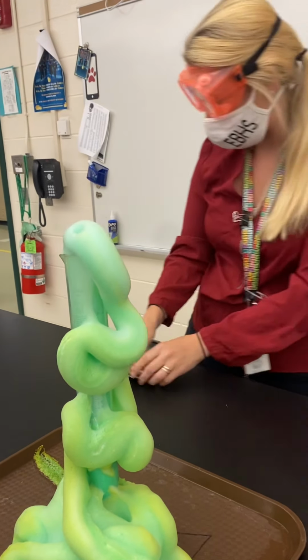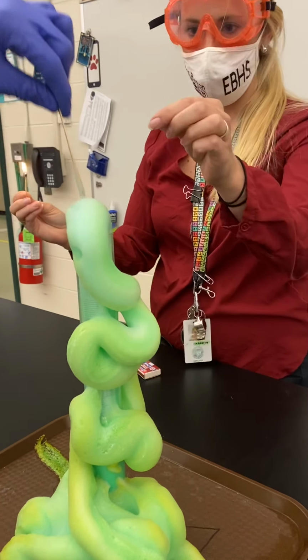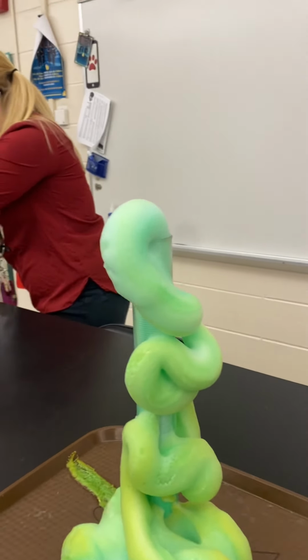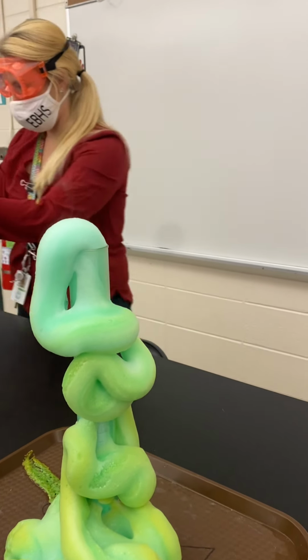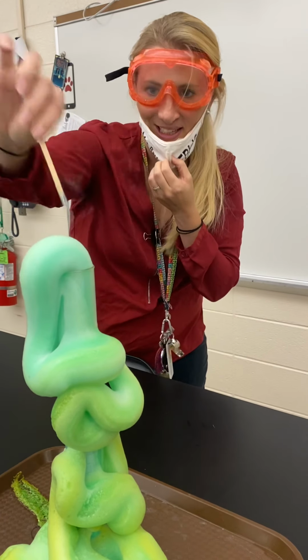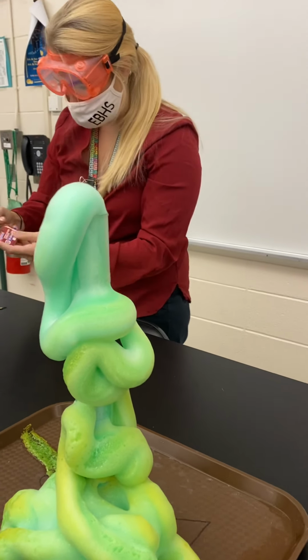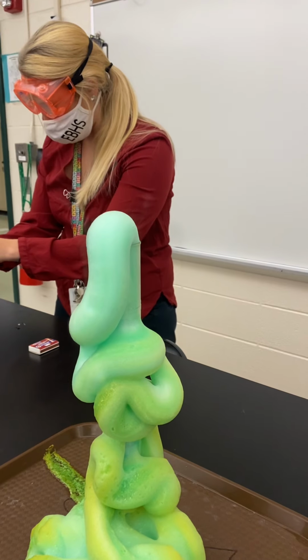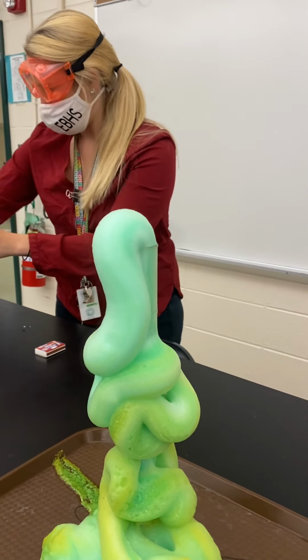Oh, well, we didn't do a good job. Try it again. Slowly. Just when you put it in, go slowly, because if you go too fast, you're gonna put the flame out anyway. Slow down. It wasn't enough. Sorry, guys. Welcome to science. Total fail. The mask doesn't help because it's harder to get the mask off to blow it out. But I guess that's what we're dealing with.